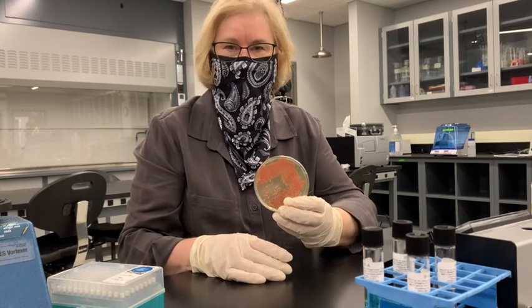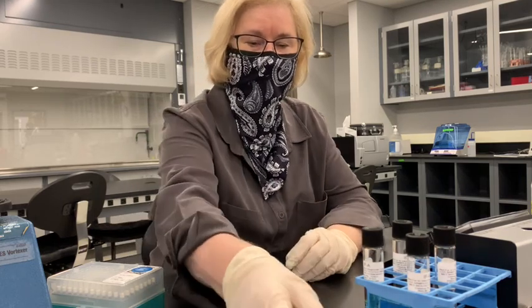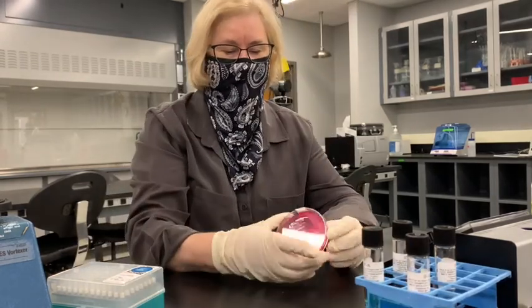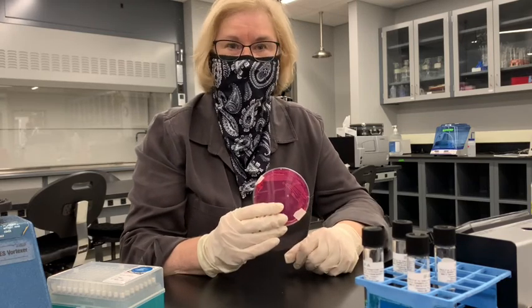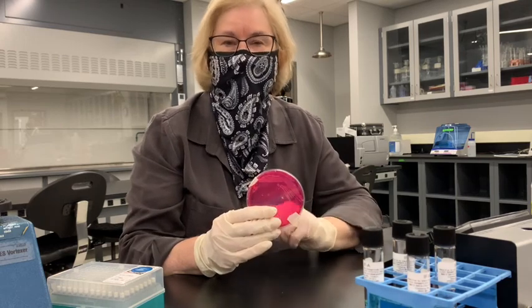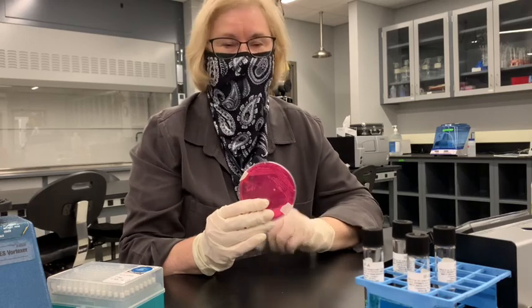They figure out that they have Serratia, and we know what that is, so that's a good one to use. And then the other one is my plate. You might recognize this. We saw it when I was home, but now it's here. We're going to pick one of these colonies and try to figure out what it is.